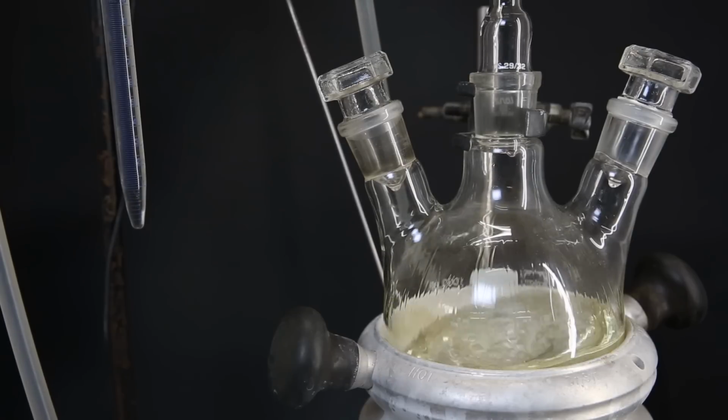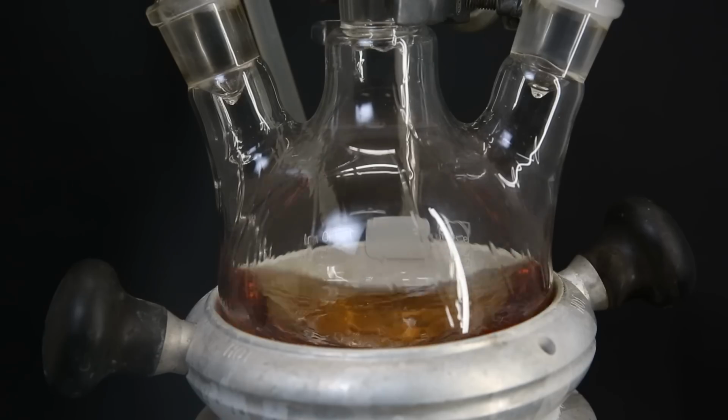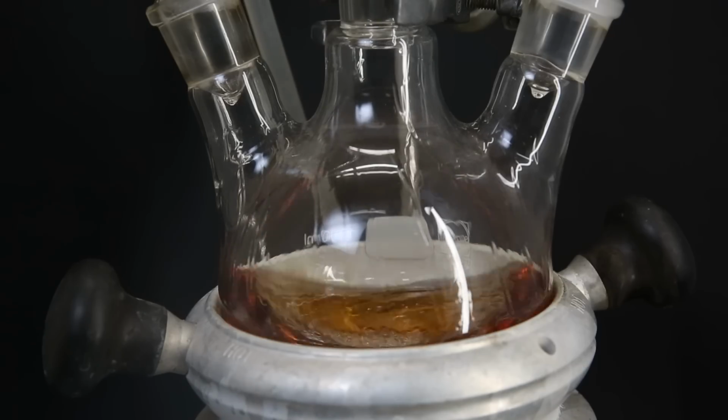Anyhow, I leave it to reflux for 24 hours. So I come back the next day and the mixture has turned red, which is probably from oxidation from the air.